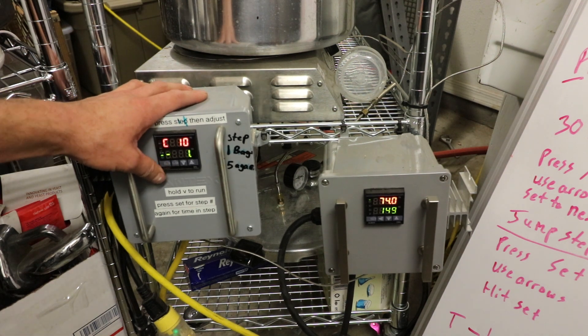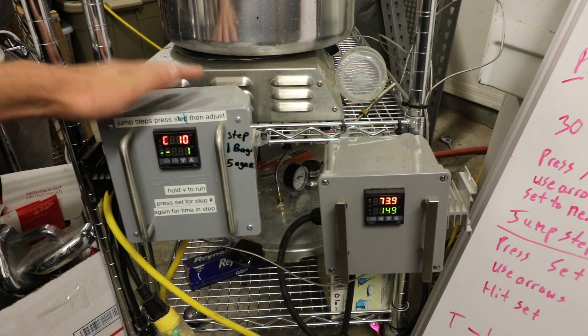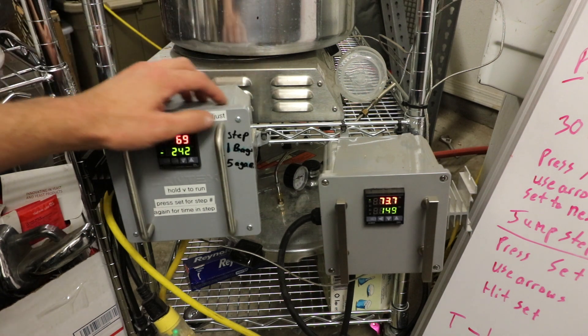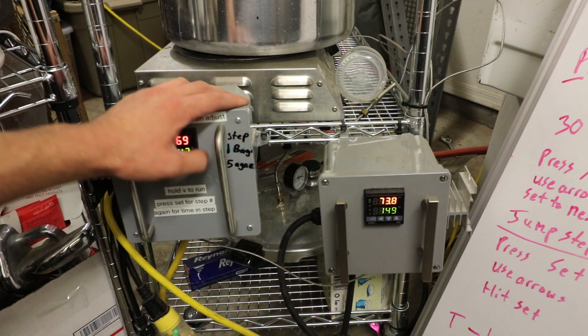That's the end of the process, and what it'll do is it'll flash stop. From there, what you can do is, let's say I have different programs. Like I'll have this one for the Presto, and I'll do bags in it, like spawn bags, or I'll do agar.